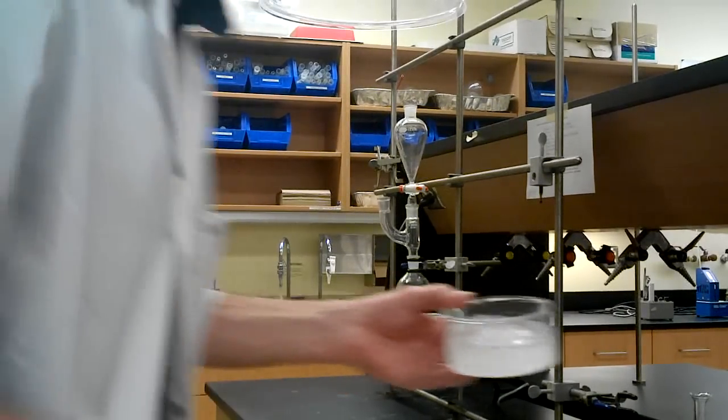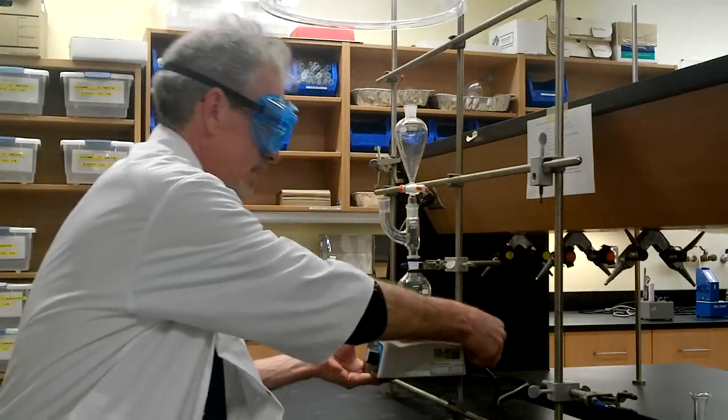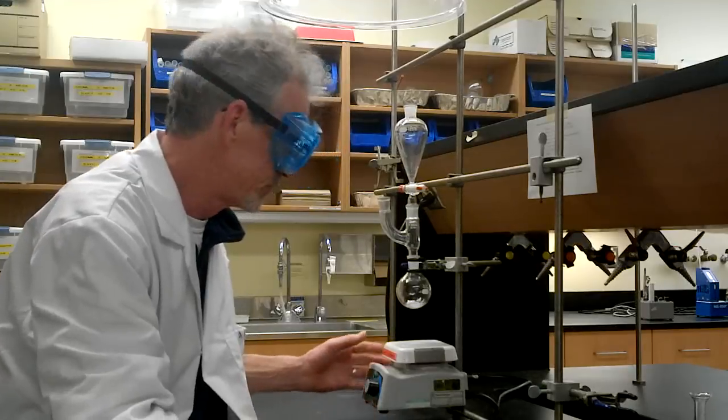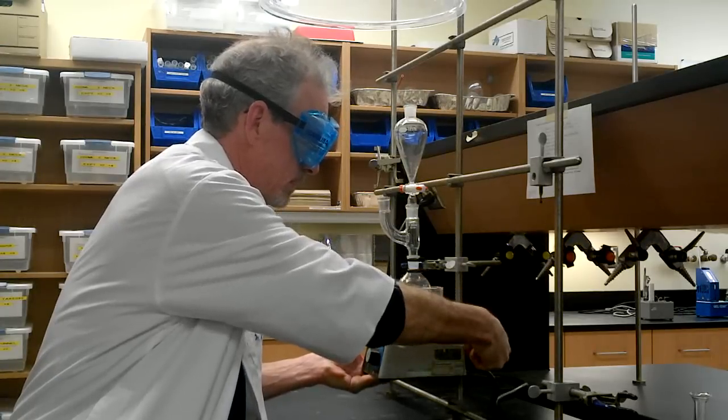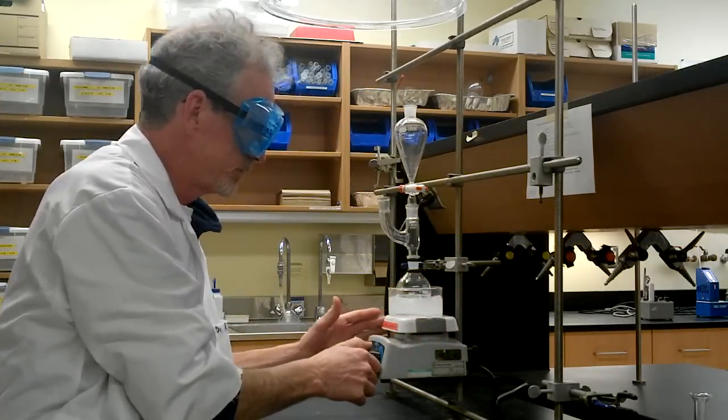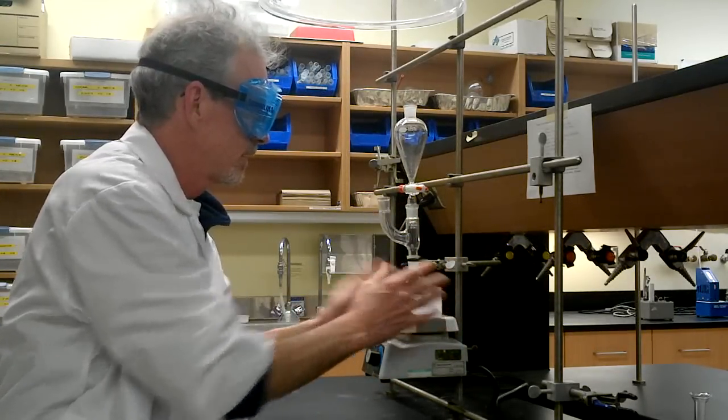So here I have my little slushy bath. Drop down the stir plate, and that goes there. And we will resume stirring.